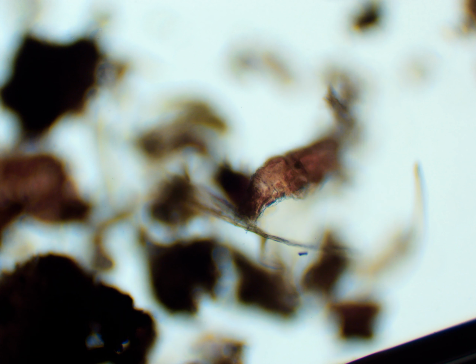It is a far larger multicellular organism than a smaller rotifer or a gastrotrich. It's a lot larger than some of those, like a rotifer from the class Monogononta. Here you can see it here.